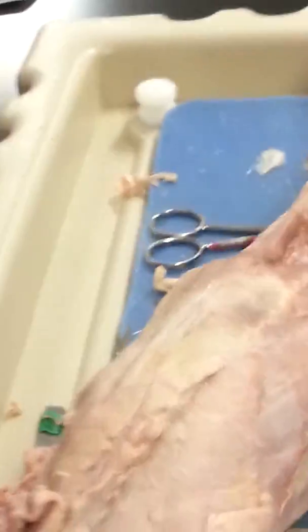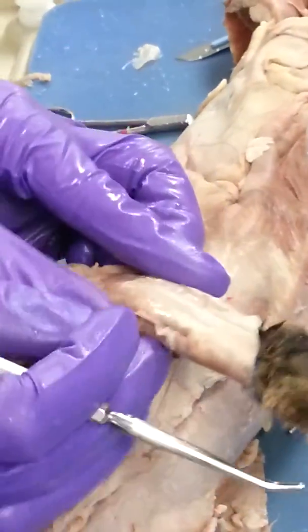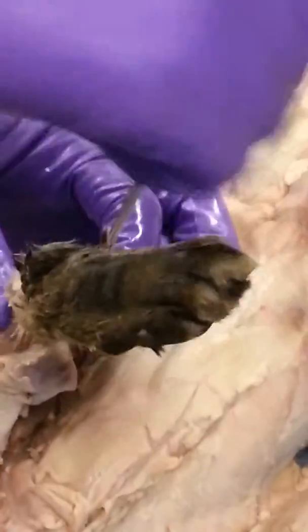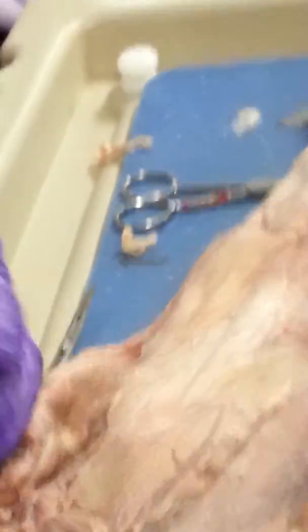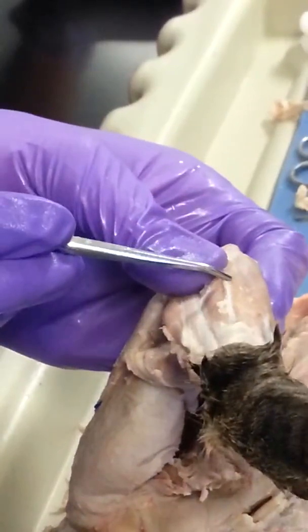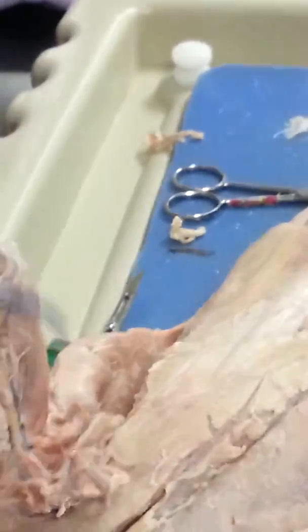So that's the back side of the arm. You can do it one of two ways. I kind of just keep going in a circle, because if you find the extensor carpi ulnaris, then you're going to know the flexor carpi ulnaris because they're right next to each other. Or you can start back at the elbow. So it's your choice.